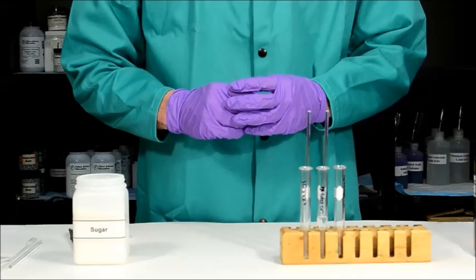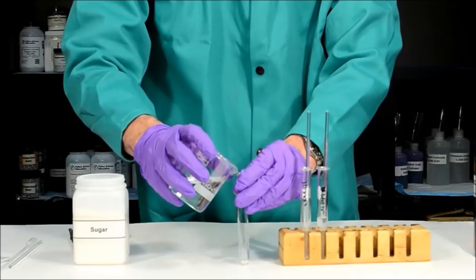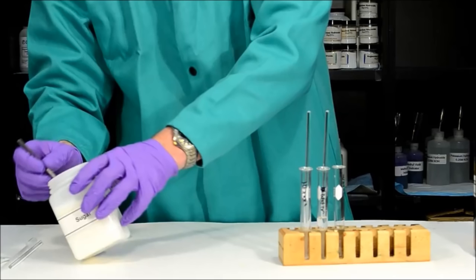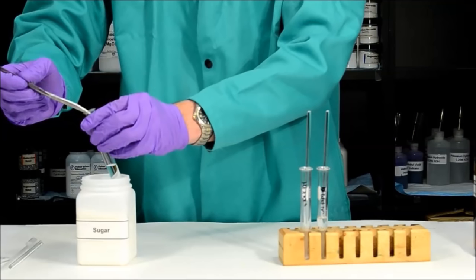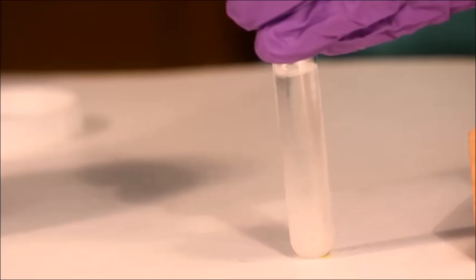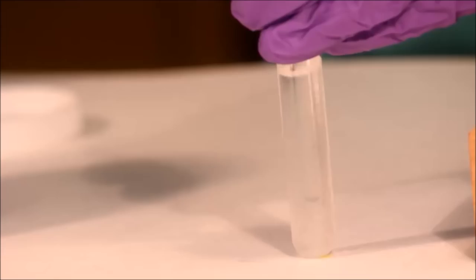One common mistake when performing this experiment is using too much solute. To demonstrate, I'll add an inch or two of water to another test tube — the exact amount doesn't matter since this is qualitative. This time I'll grab a large amount of solute. Even though sugar is soluble in water, if I add a massive amount and gently stir, you'll notice the sugar is unable to dissolve — not because it isn't soluble, but because we've exceeded the saturation limit. It's important to use a very small amount of solute.